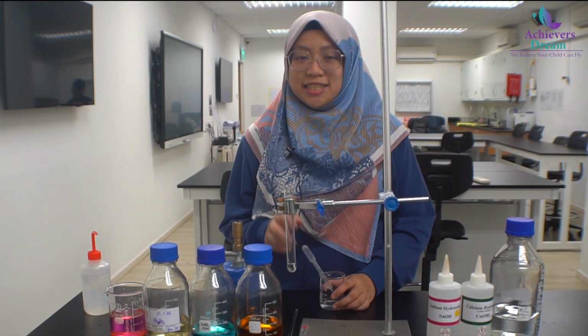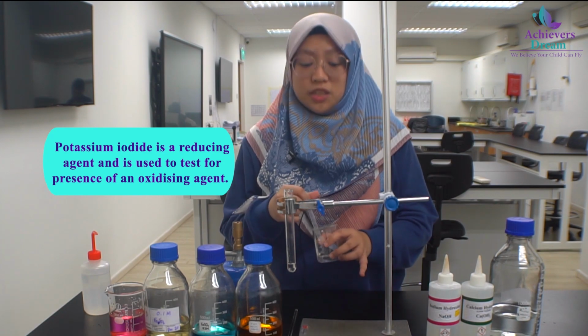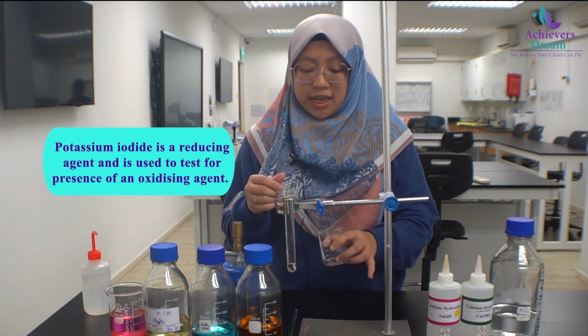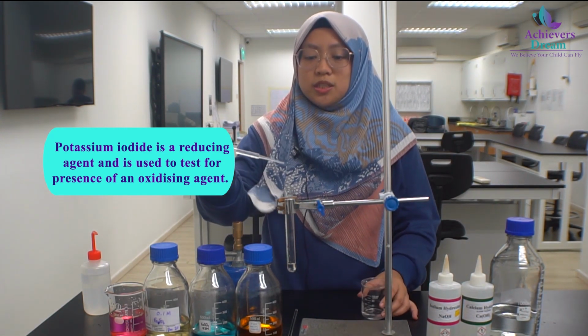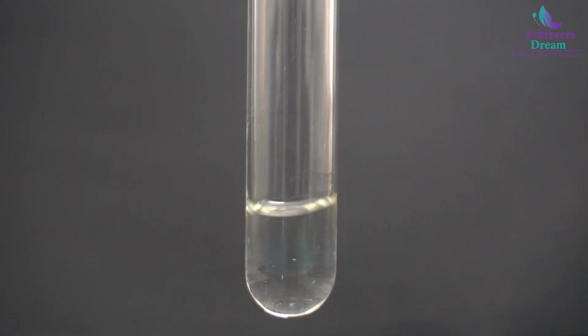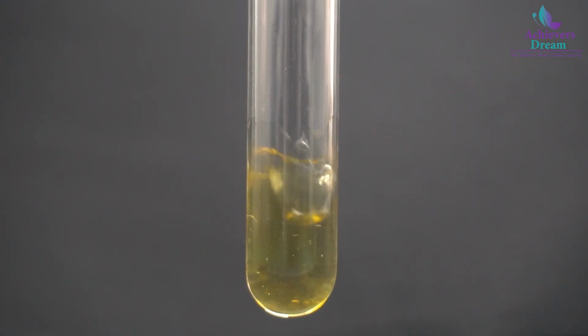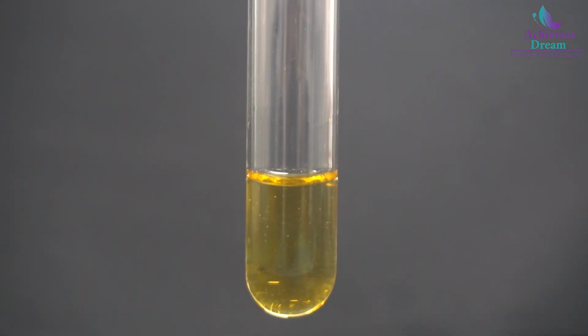Okay, so the second test is the addition of acidified potassium iodide into a test solution. Students need to know that acidified potassium iodide is a reducing agent, and when it is added, it is used to test for the presence of an oxidizing agent. So what is a positive observation? It is when the colorless acidified potassium iodide solution turns brown.